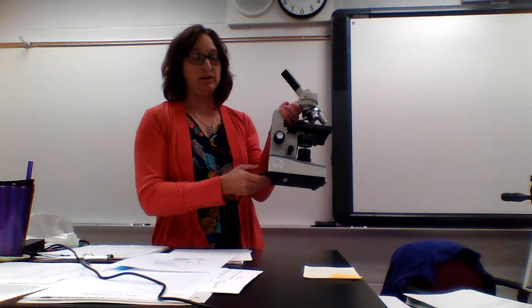Next, we've got the coarse adjustment and the fine adjustment. The coarse adjustment is the very large knob compared to the very tiny knob. And my study strategy for that, hopefully, is easy to remember. When you think about sand and sandpaper, especially those of you that are in wood shop, if you have coarse sandpaper, that means the grains of sand are bigger. Fine sandpaper, the grains of sand are very, very tiny. So the word coarse, you're thinking big. The word fine, like a fine grain of sand, you're thinking the smaller one.